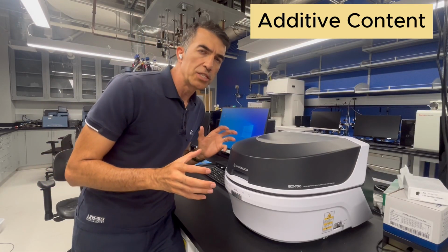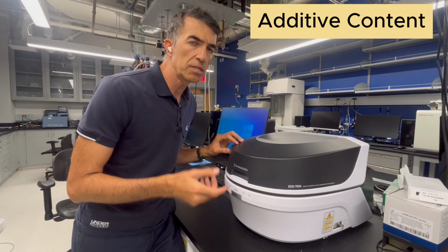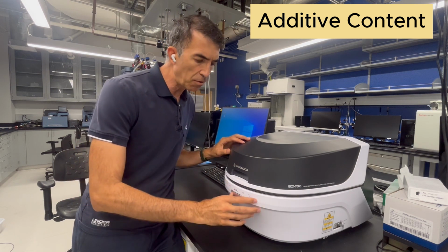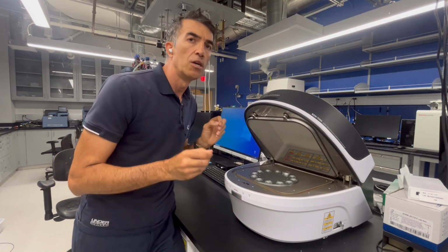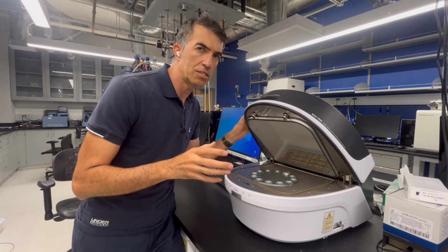One of the other machines that we're going to use for this root cause analysis is the EDX-7000. It's an X-ray machine, and it will shoot X-rays into the samples to identify the quantity of the additive inside the compound.